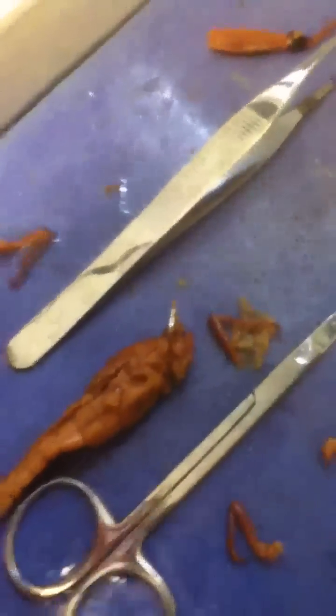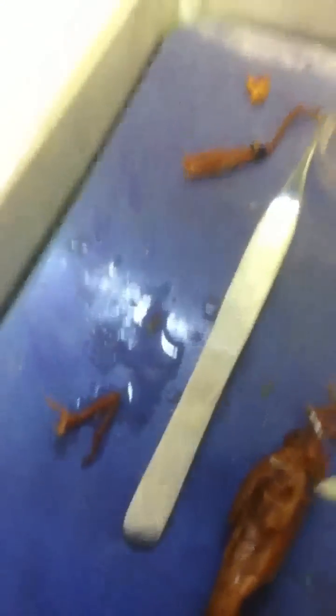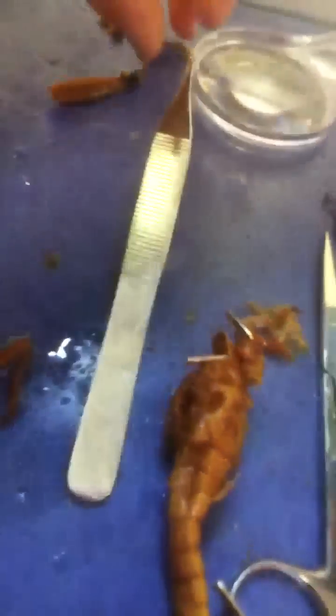I gotta wash my hands. Hey Tim! Holy cow, oh God. I don't have it! Just so we can try to — give me your phone! Please do not drop your phone on the grasshopper. The worksheet's all done. I just did it for you. Thank you, I have all the answers. I'm gonna go turn them in. We're not done torturing this poor grasshopper.